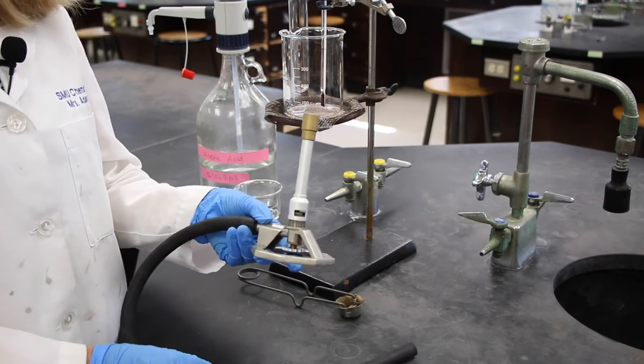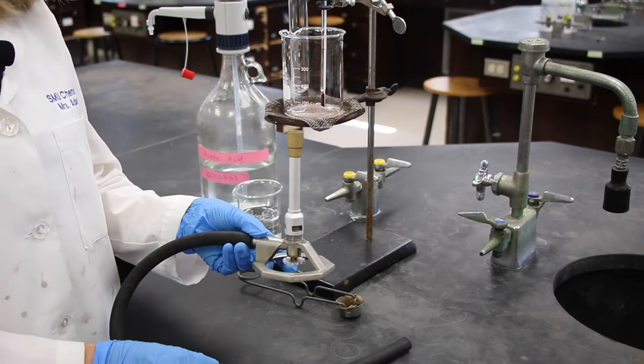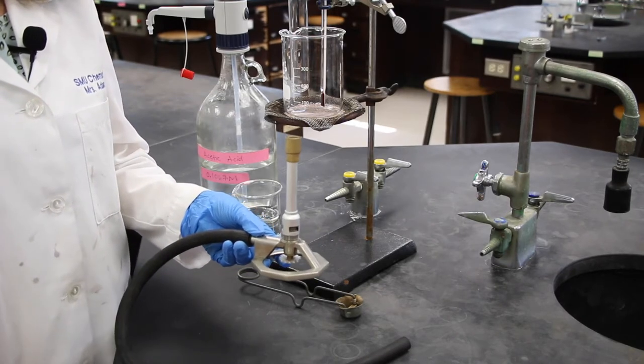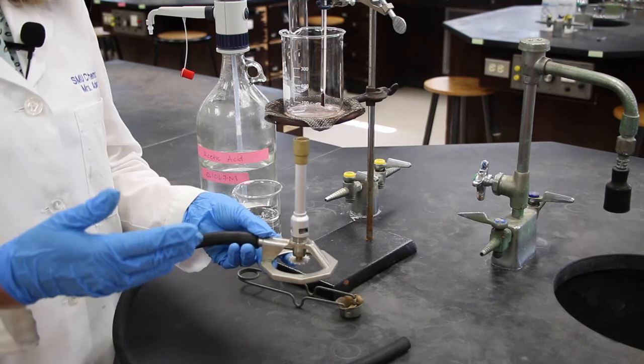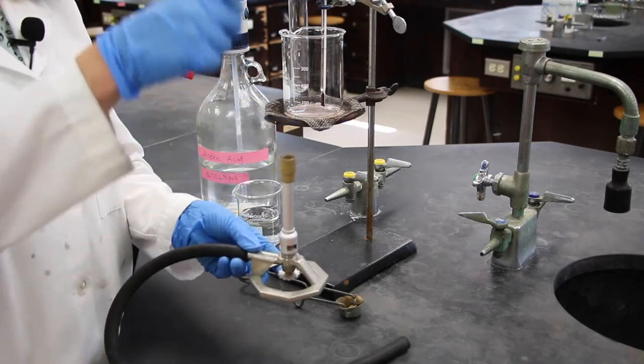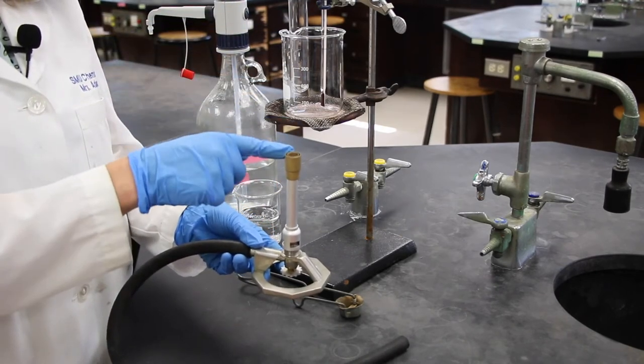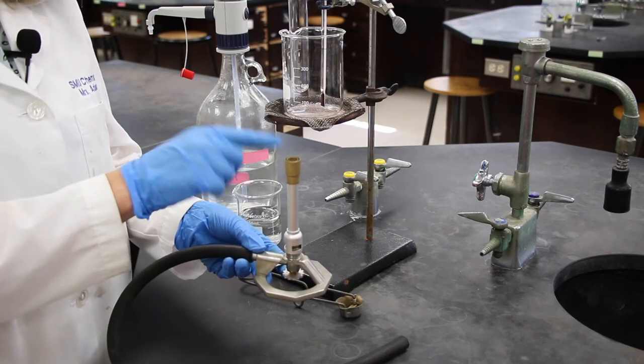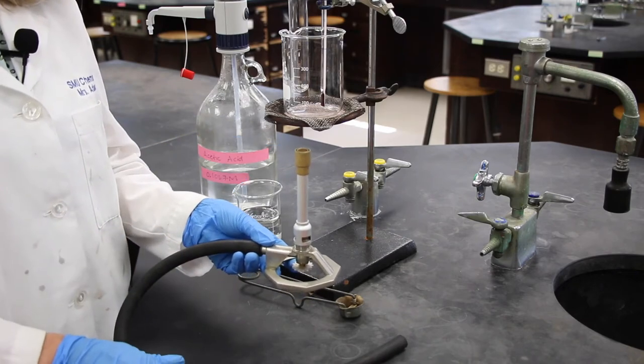We want to have a blue flame, which is a hot flame, very clean. And we will like to have a large cone of blue, and usually a smaller cone of blue within it. There should be no yellow in that flame.